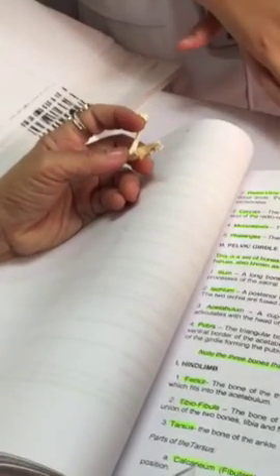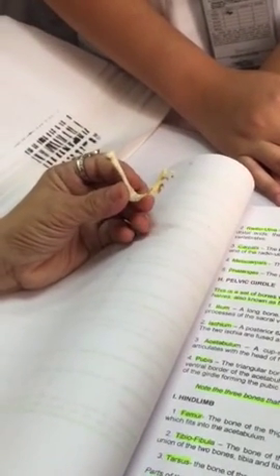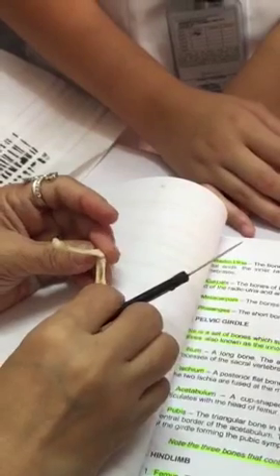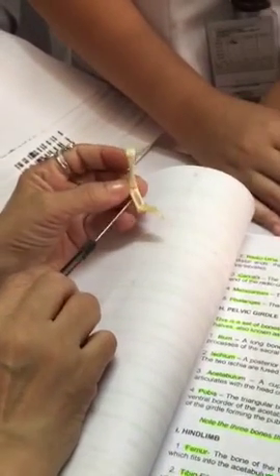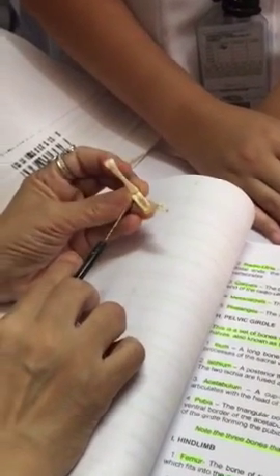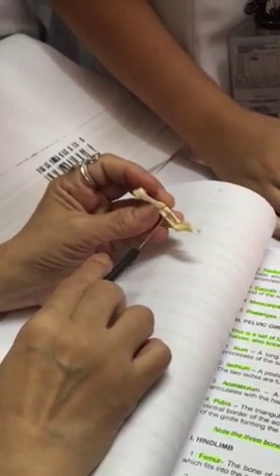What is the description of the calcaneum? Bigger, longer, and post-axial, outer in position. Bigger and longer. So to avoid confusion, just remember it is the outside one, the longer one. So you have the calcaneum, and then you have the astragalus.